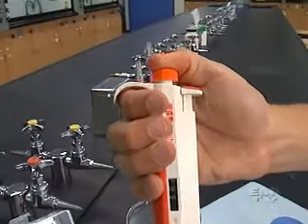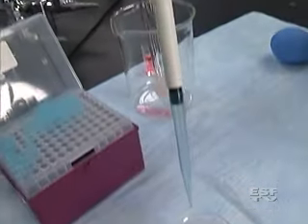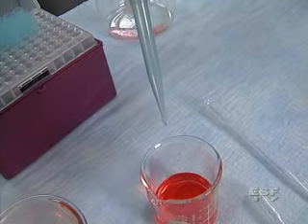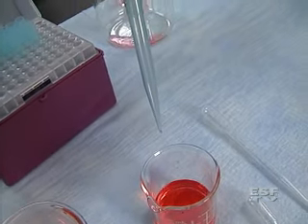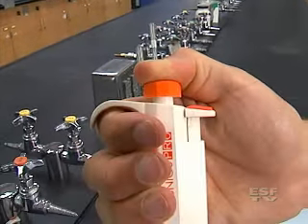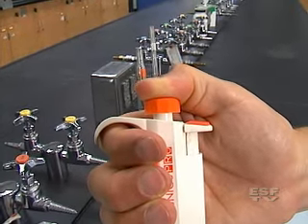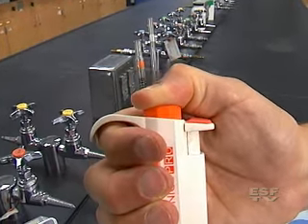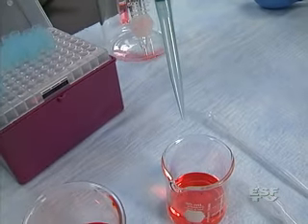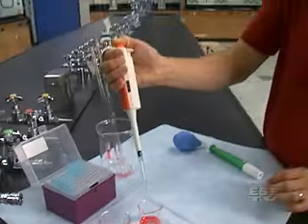Sometimes you'll notice that at the end of the tip there's a small little droplet. On this type of pipette, we do want to make sure that last little drop comes through. So I'm going to push it down a little bit more — you'll notice a second stop. As I push it down a little bit further, that droplet has now disappeared and it's gone into the beaker.